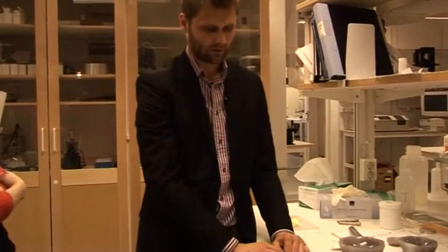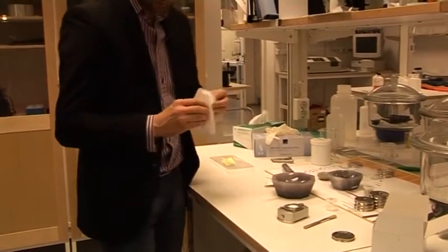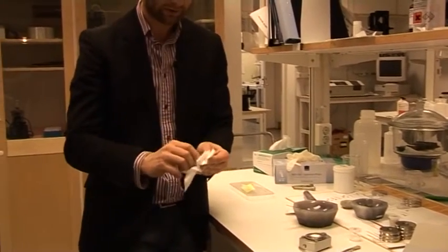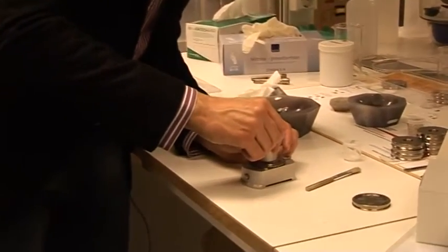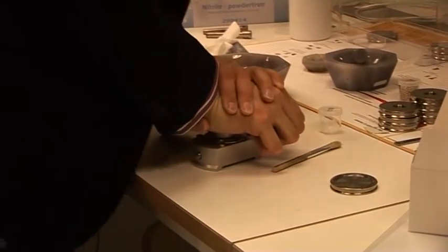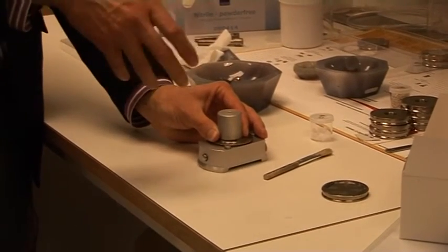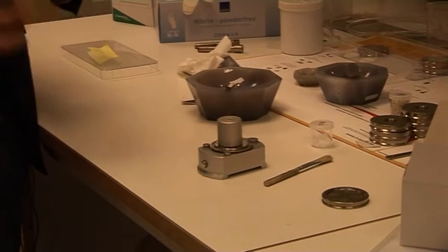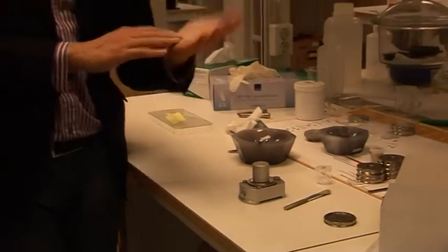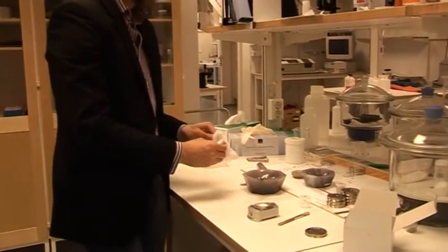Then you take the sample press, make sure it's clean, and then we try to compress it down to get a nice pellet of the powder. You can press quite hard. Usually I think it's good to avoid any extra twisting because you can implement some orientation problems. But some samples are very tricky, that you probably have to twist it and then slide it to actually get the sample in this cavity. Let's see what we get now if I just remove it. I think it looks fine, this is an easy sample.